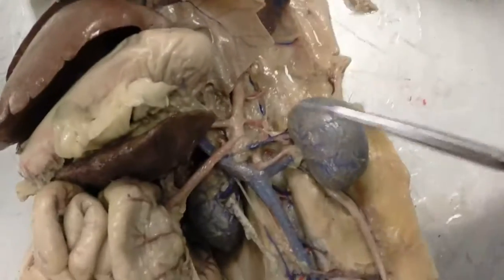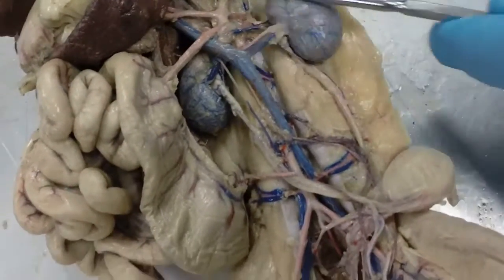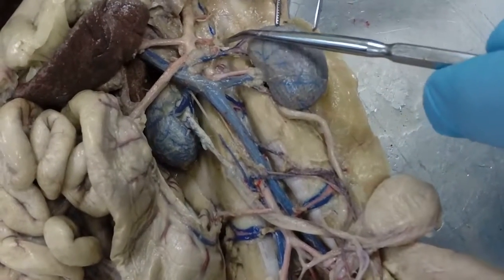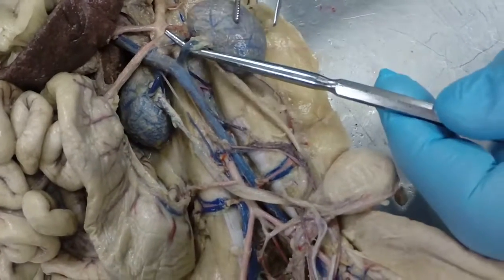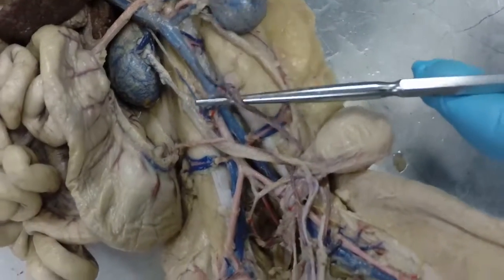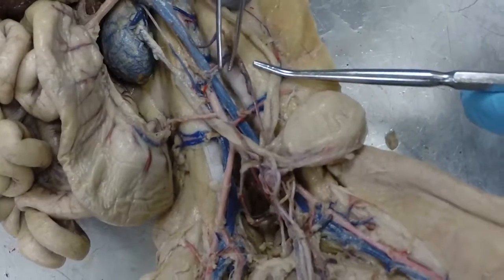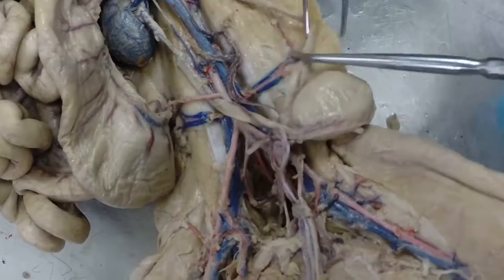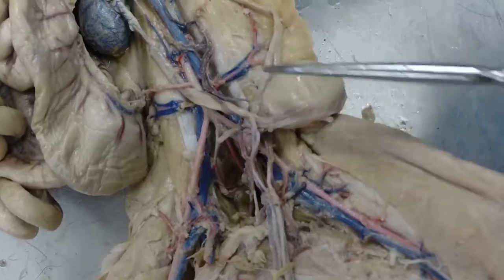Okay, here we are at the postcava, and you can see this branch. This would be our adrenal lumbar vein. Do we need to know that one? Mm-hmm. Okay, there's our left adrenal lumbar vein. Here's our left renal vein going to the kidney. Here's our left gonadal vein. Of course, it would be whatever one is the vein in here, but I'm not really separating them. So, right there. Okay, then we have the left iliolumbar vein right there.